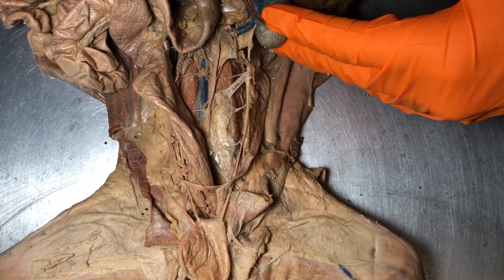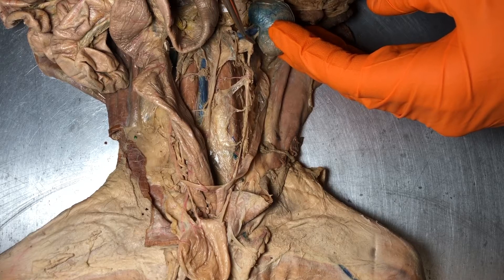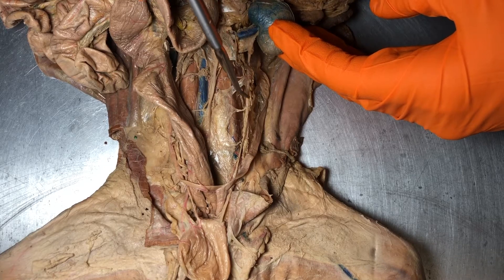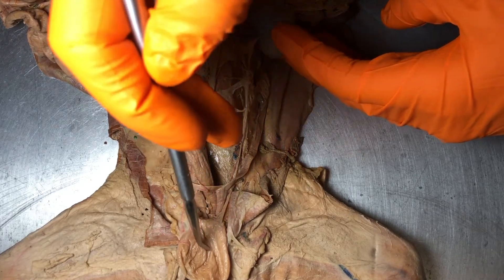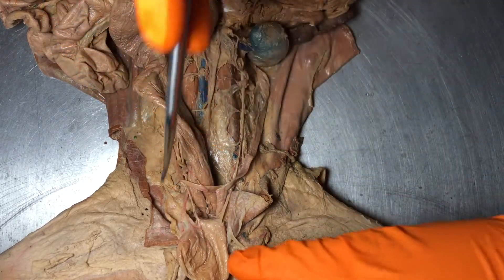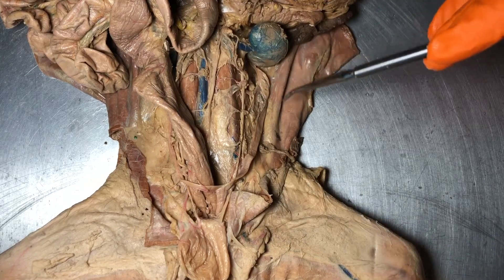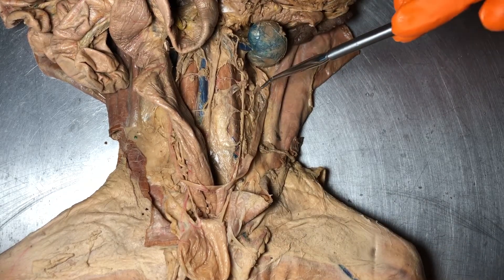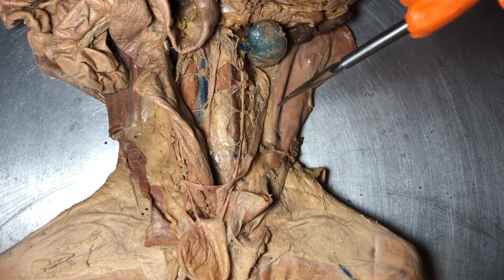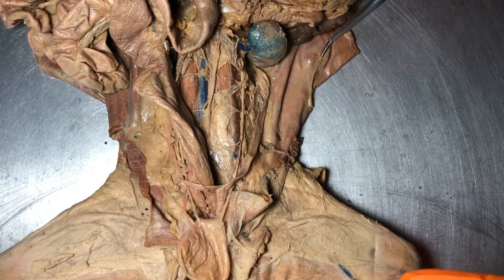Let's go to the left side. This tube — you can see it coming out of that left kidney — we follow that along and it connects to the urinary bladder, so you know without a shadow of a doubt that is the left ureter.